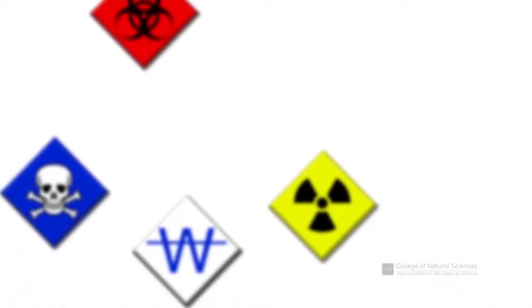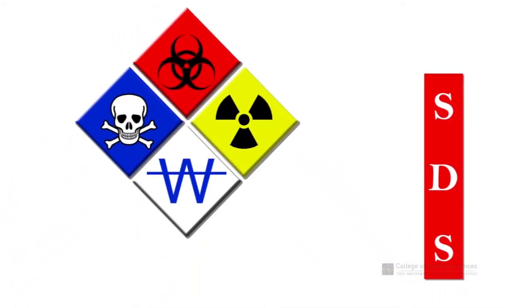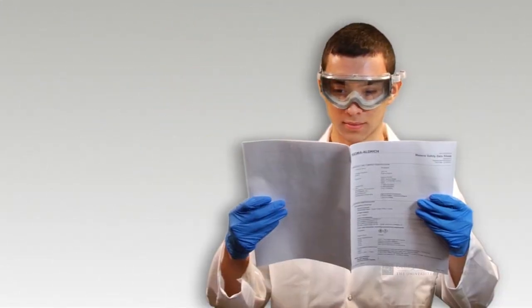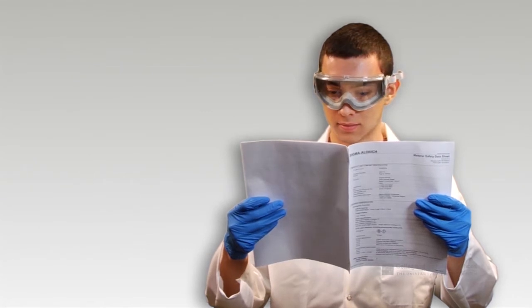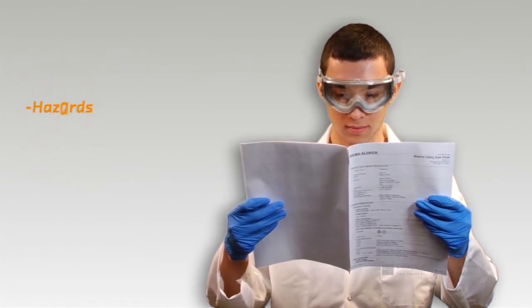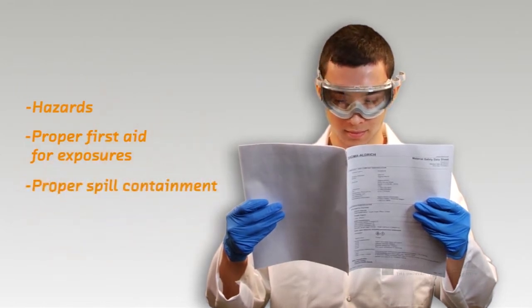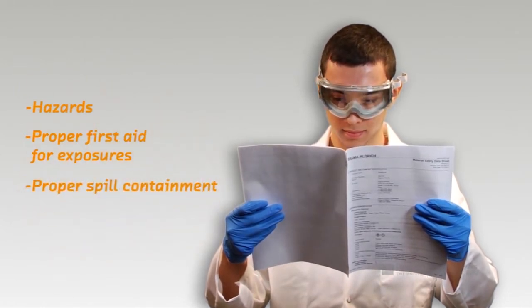In addition, you should read the Safety Data Sheet, or SDS, for all compounds that you will be working with while in the laboratory. The SDS contains important information about the compound, including hazards, proper first aid for exposures, proper spill containment, and physical characteristics of the compound.